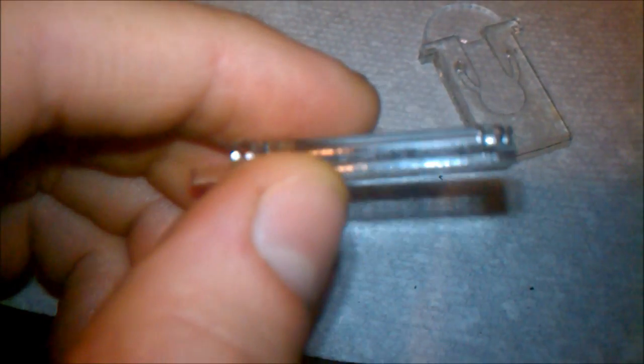Hi, I'd like to tell you about some microfluidic cuvettes we made using laser-cut acrylic and double-sided sticky tape we got from a local craft store. So I've got here some micro cuvettes that are made with 1/8-inch acrylic, cut with this laser cutter, the full spectrum laser cutter, sandwiched together by a thin layer of this stuff, thermoweb PEELnSTICK, double-sided adhesive sheets. I think we got this from just the local craft store.